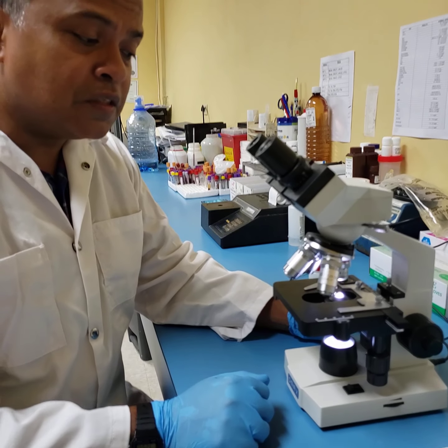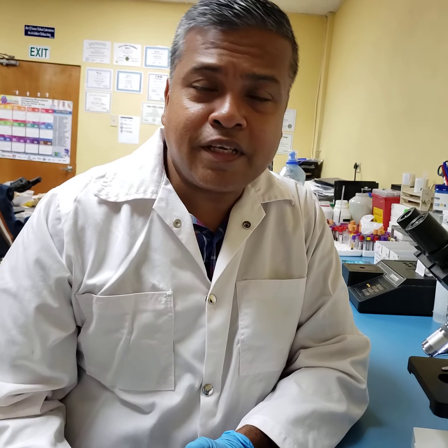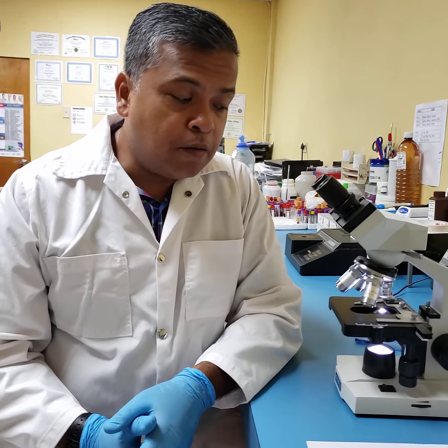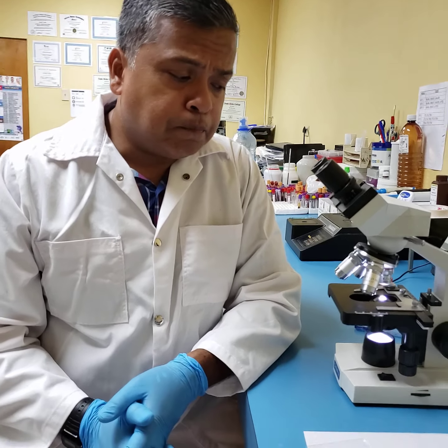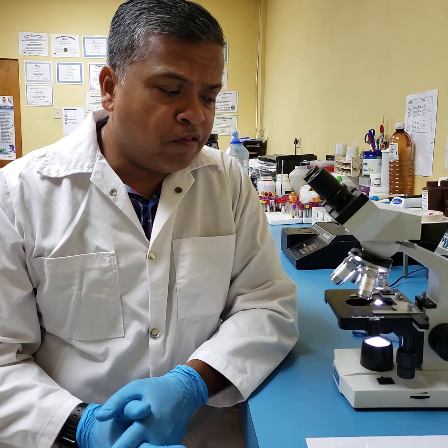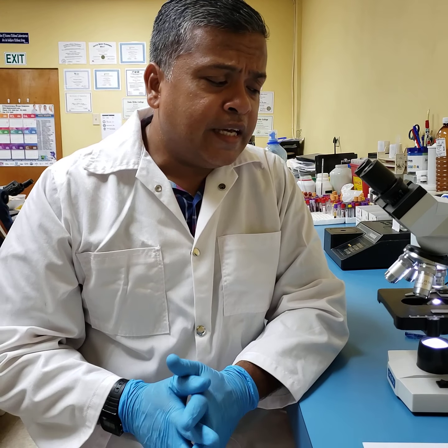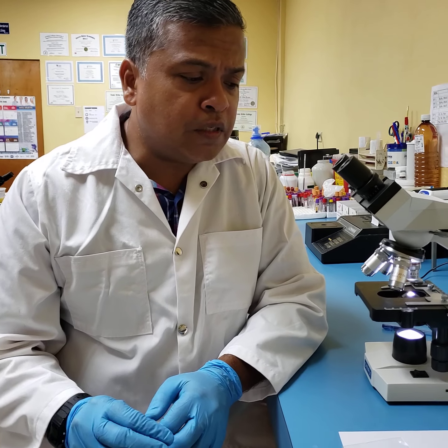All right, so students, this is one segment of tutorials aimed at enhancing your abilities in the laboratory, and this is your very basic and fundamental introduction to the microscope, its use, and its basic anatomy.